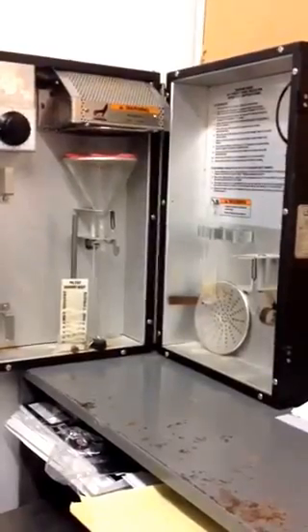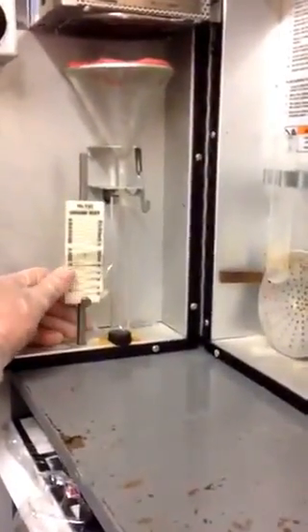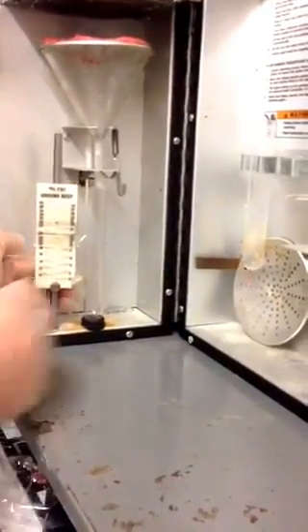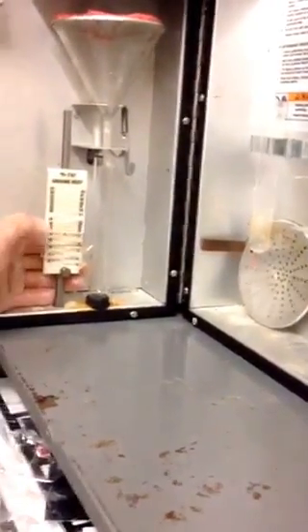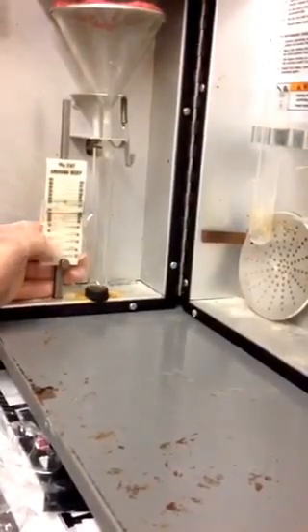And then as it's done, it separates the fat. So you use your guide, you set the guide to where the fat is above the water, and then you use the upper guide to find out where the fat content is. And that's how we test.